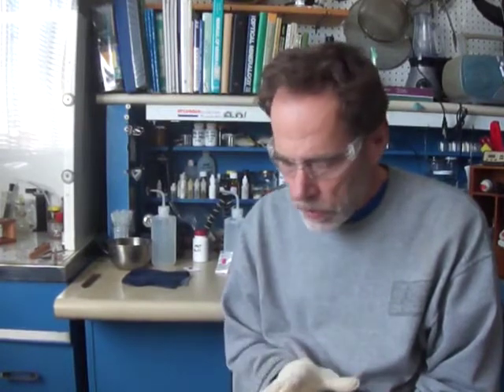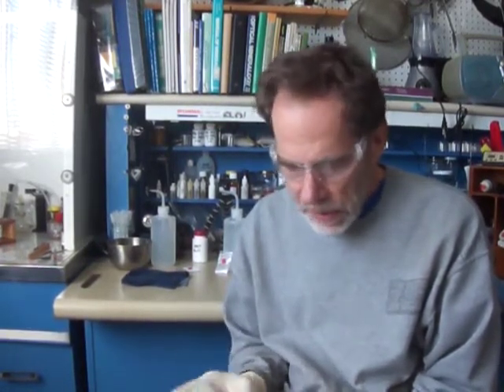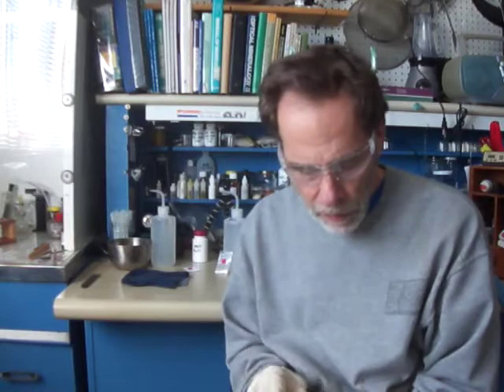One uses the solid material with concentrated sulfuric acid to see if it effervesces and what the gas might be, which narrows down what it could be. The second is a silver nitrate test that precipitates out different materials or not. And the other one uses barium chloride.